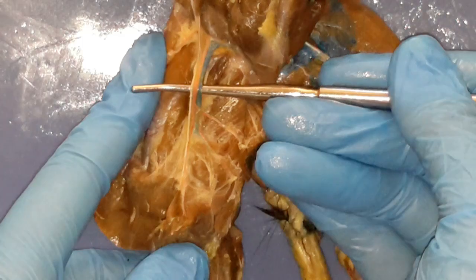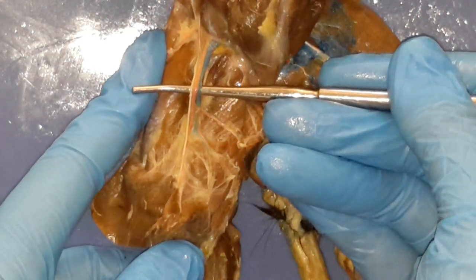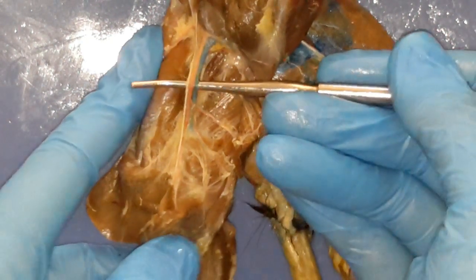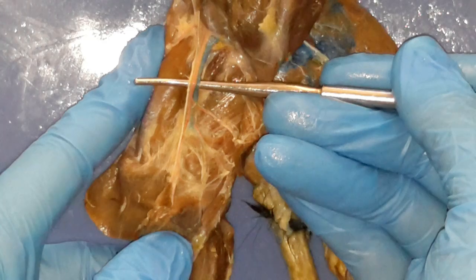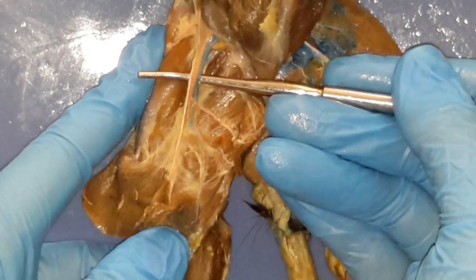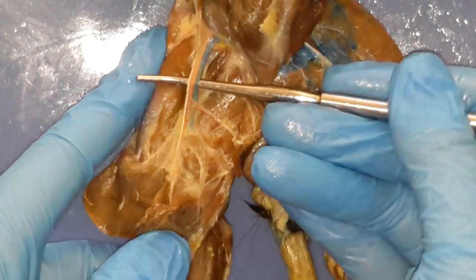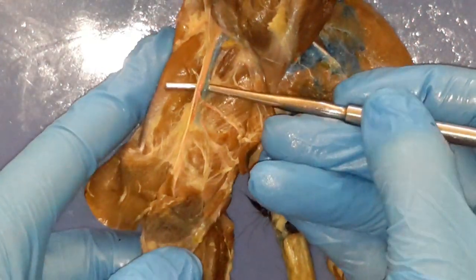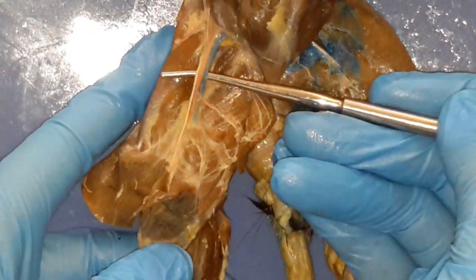What's the white band? What nerve? What region are we in? The leg — the femoral nerve. Then what's the red one? The femoral artery. And then what's the blue one? The femoral vein. Do not cut these — these are important, you do need to know these.